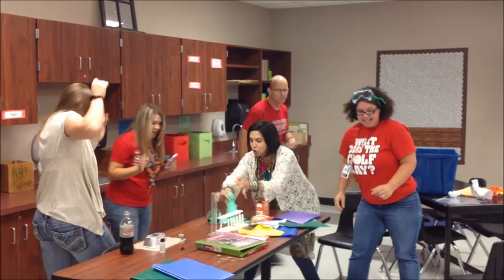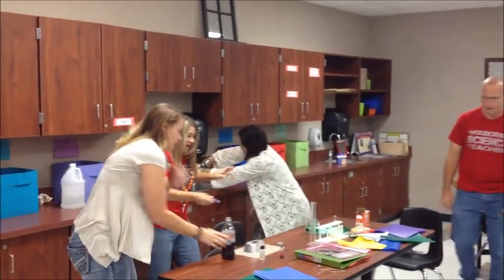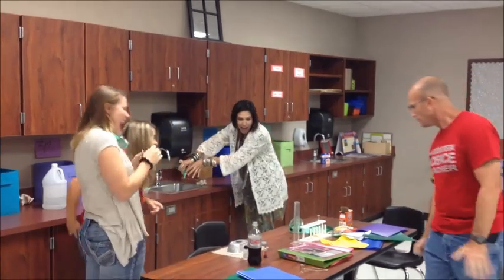Maybe we shouldn't panic. Think about your lab safety rules. That was awesome!